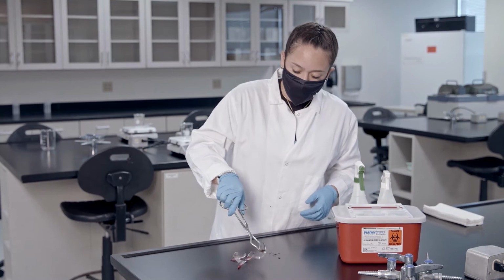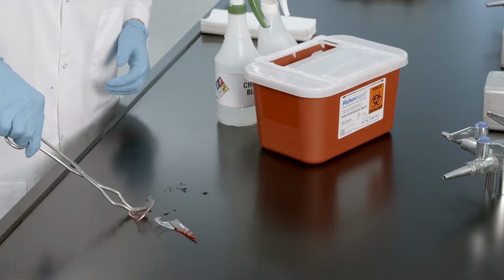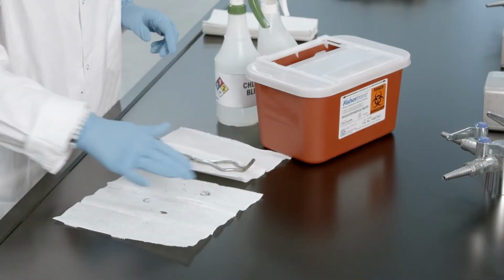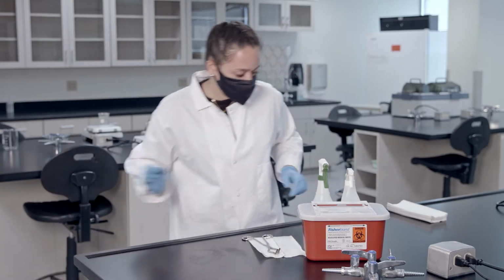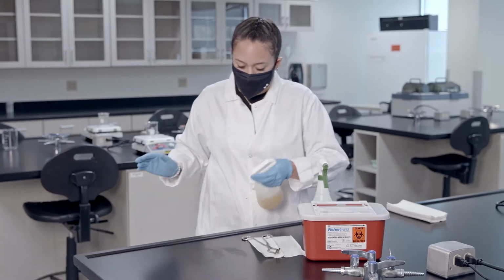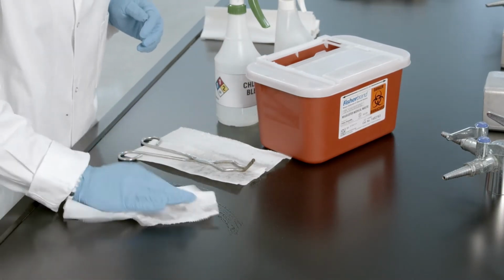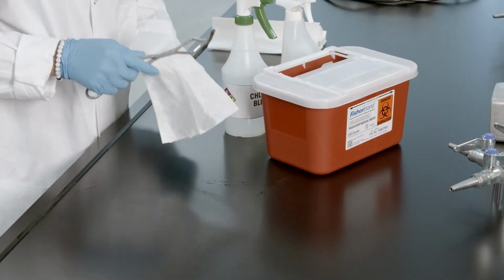When you encounter a blood spill, first collect any sharp objects, such as broken glass, with tongs and place in a biohazard sharps container. Place paper towels over blood spill to absorb, and place in a biohazard bag. Spray the area with disinfectant and wipe with paper towels to remove all visible blood. Be sure to also disinfect the tongs used in spill cleanup.